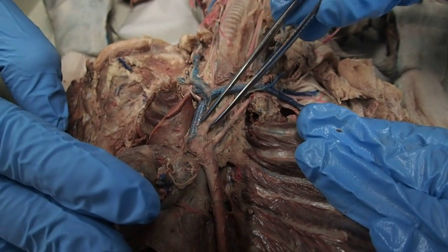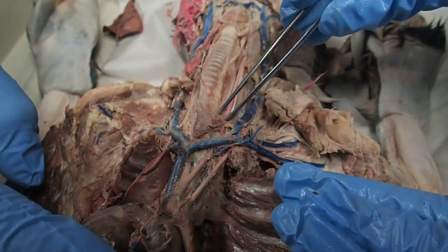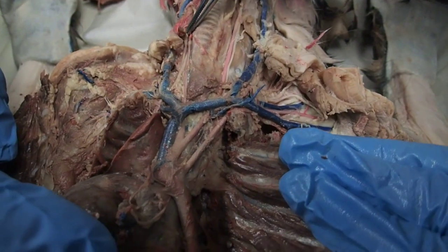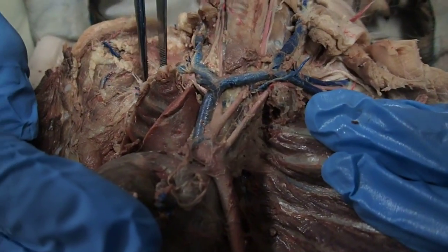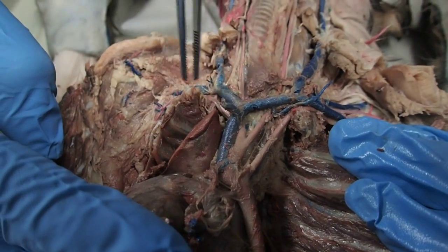Where it Y's are the two carotids, which go all the way up into the head. Then you can find the right subclavian on that side.